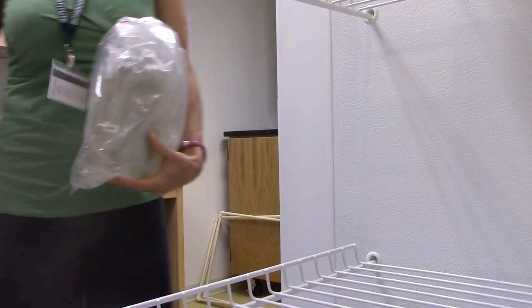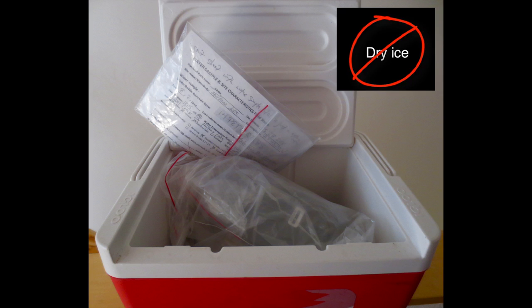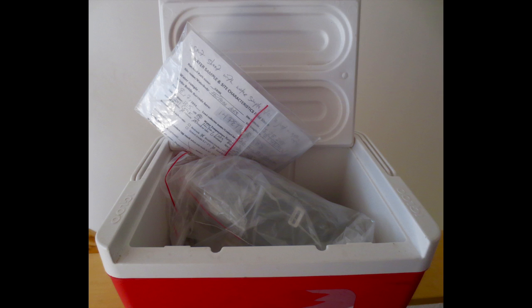To prepare the samples for shipment, put your samples in a cooler with ice, not dry ice. Place a copy of the field data sheet in a zipper bag — don't forget to keep a copy for yourself. Seal the bag with a copy of the field data sheet and place that in the cooler as well, then seal the cooler. Put the shipping label on the cooler and take to your local FedEx office or arrange for pickup.